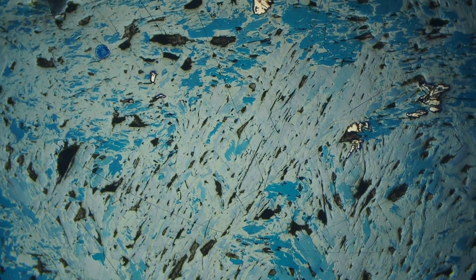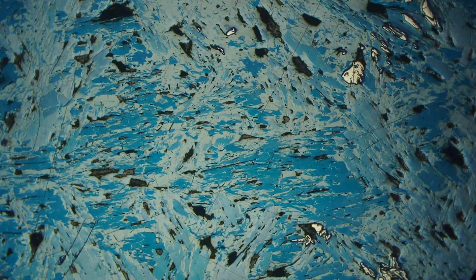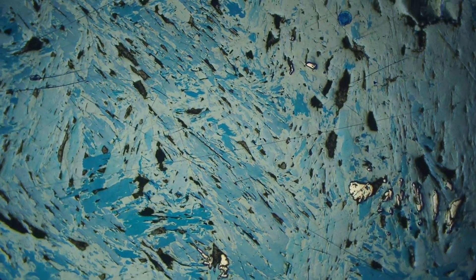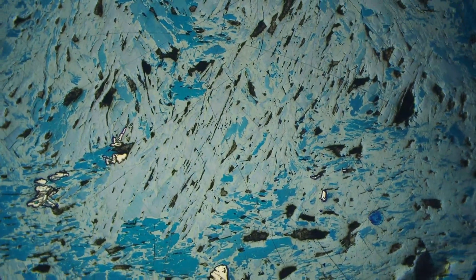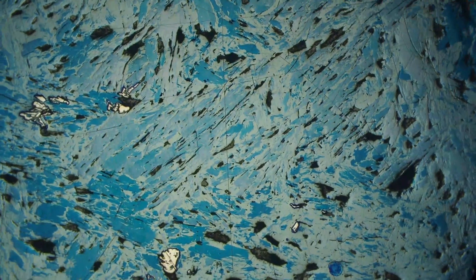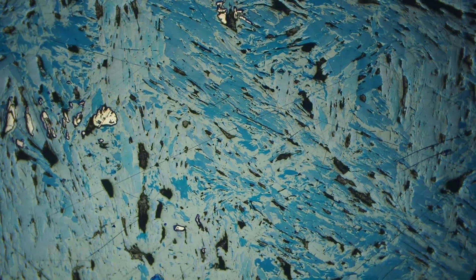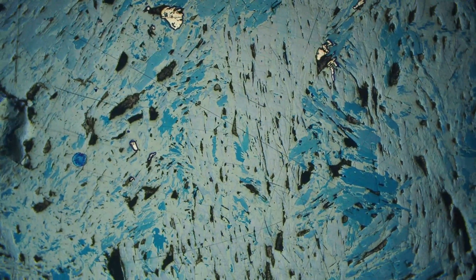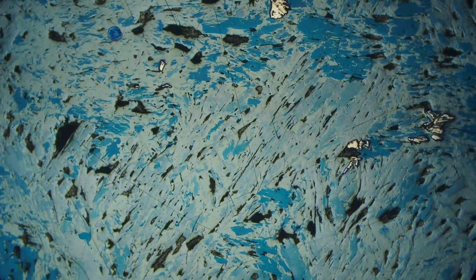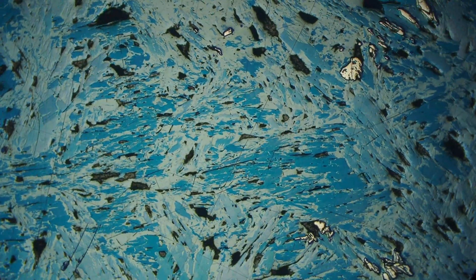As we rotate the stage they're going to go from that dark blue and violet back to light blue or white. This is again showing the strong bireflectance of covellite, going from that dark blue through to light gray as we rotate the stage.